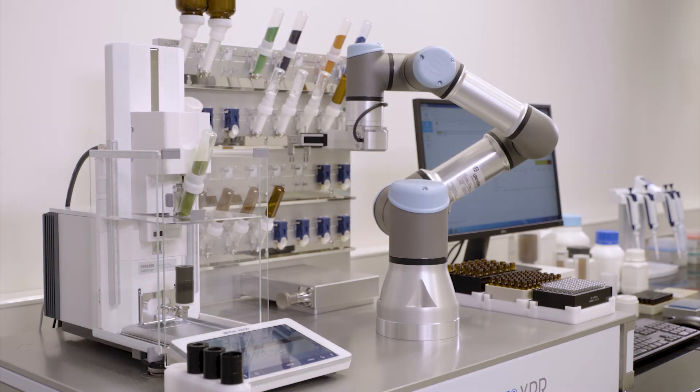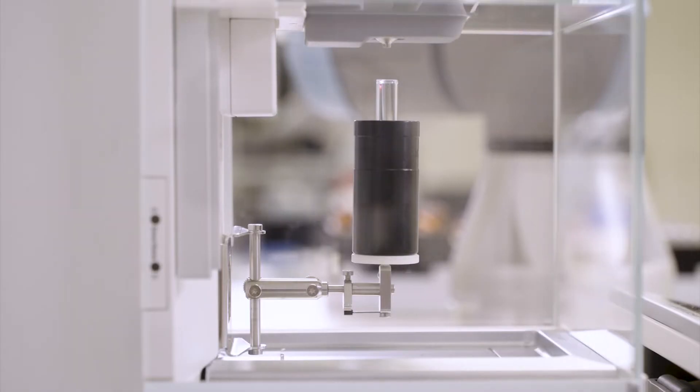The XPR automatic balance dispenses the required amounts directly into the vial.